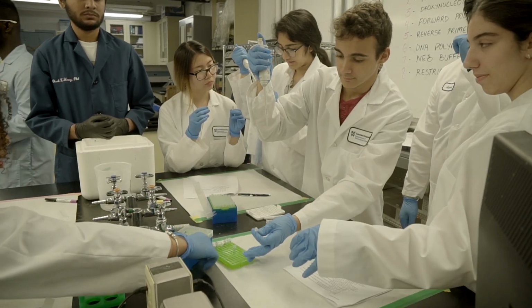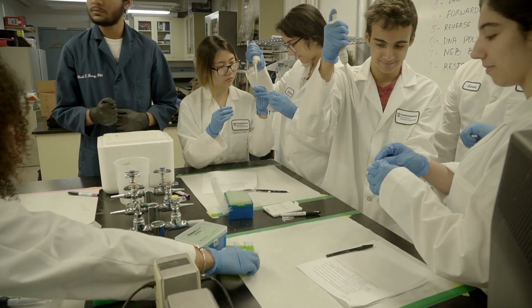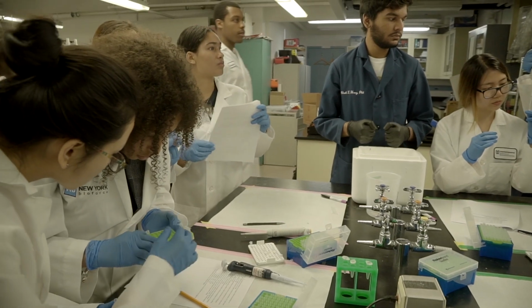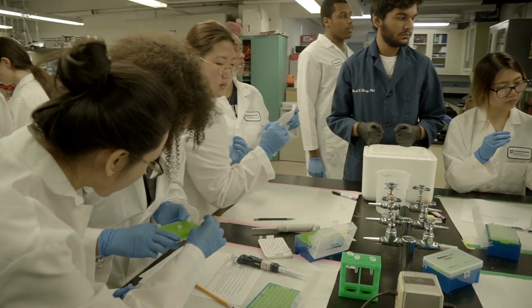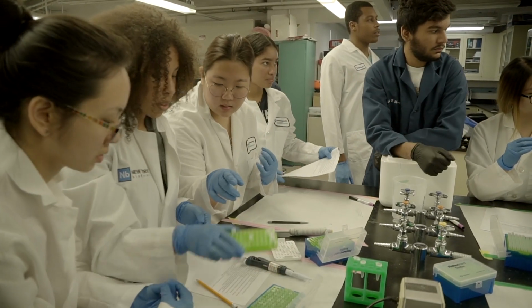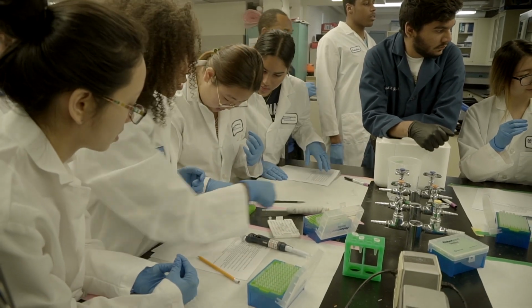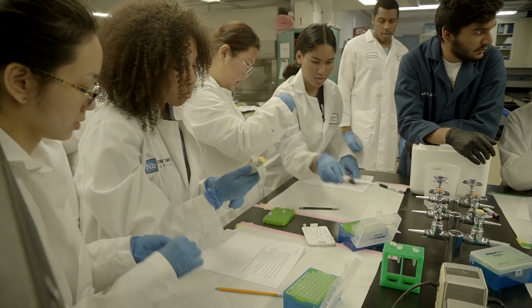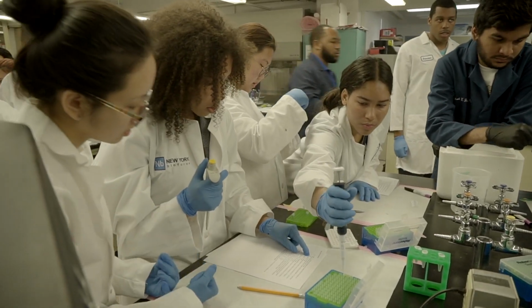You guys are also doing another nice thing as a group. Everything's lined up in order and you're putting it back in order. Yeah, it has a location now. Sometimes when you're working, you're like, where was I? So lots of times what I'll do is once I've done one, I'll put it down in one spot. So if I get mixed up, I know where I'm at.